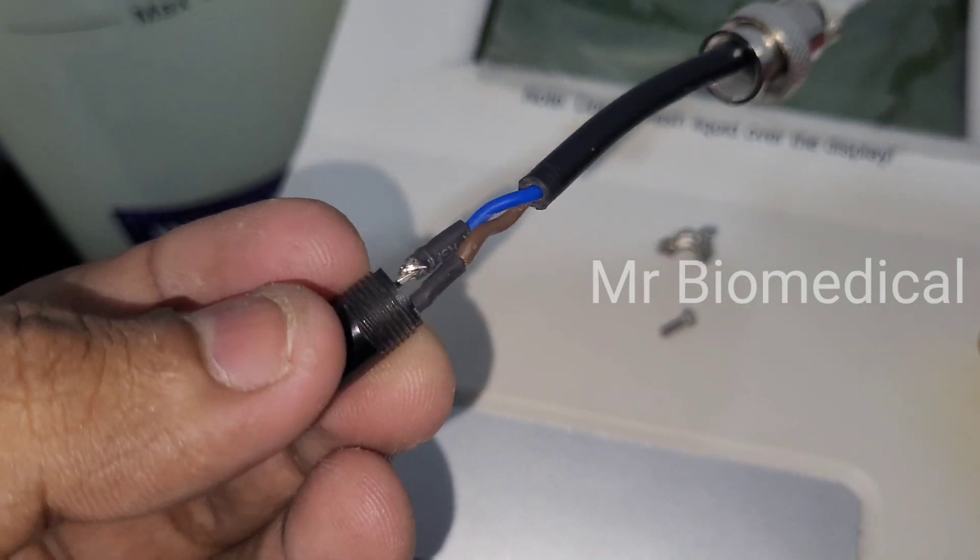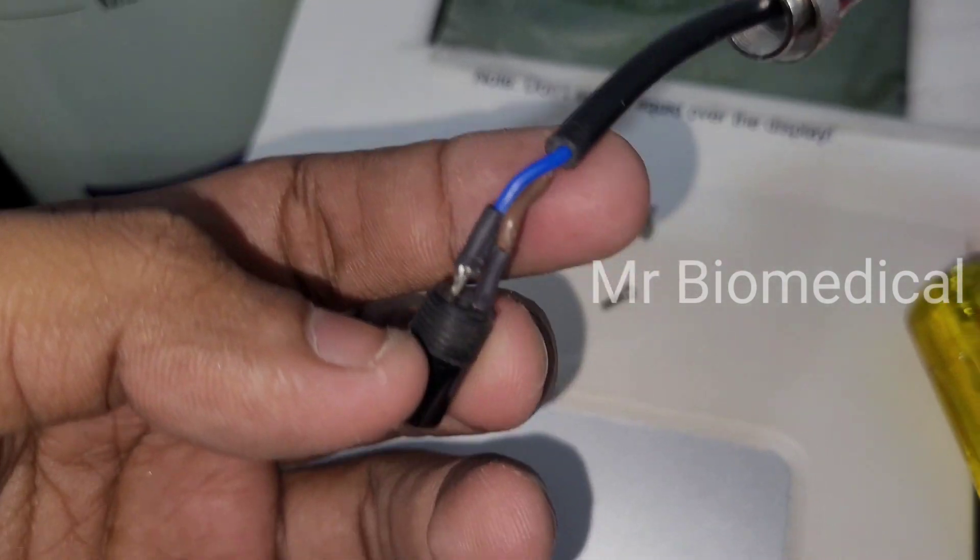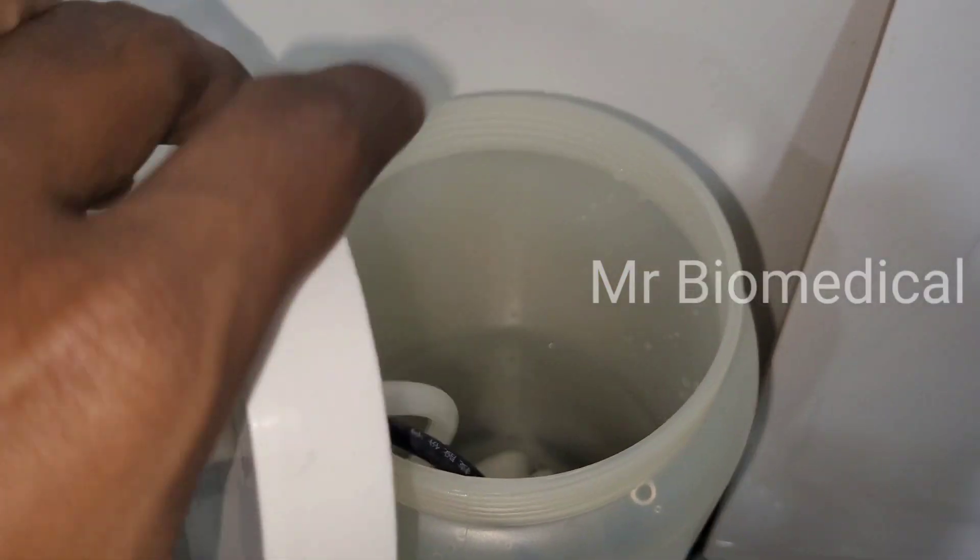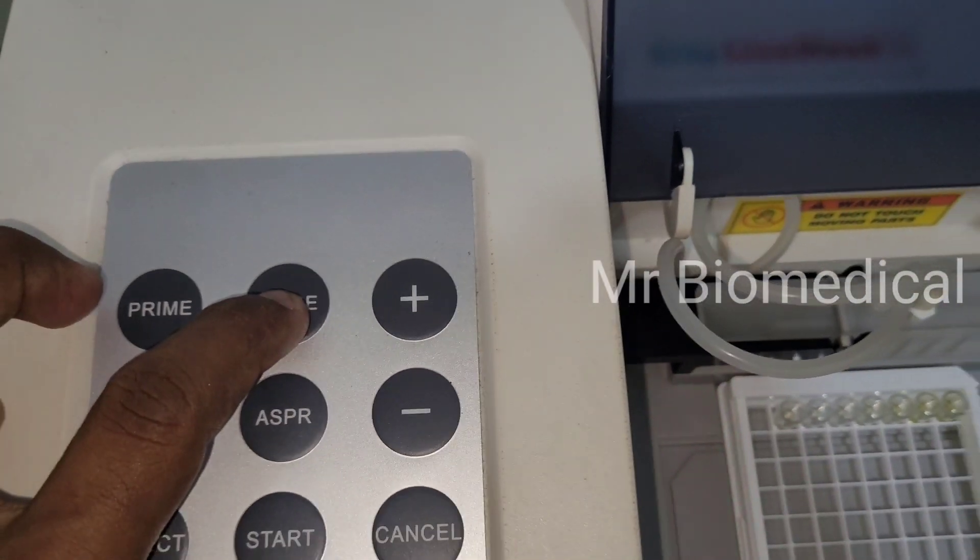Now I soldered this wire into the pin and everything is good. Now again I'm checking whether the water will come or not, so let's press the rinse button again.